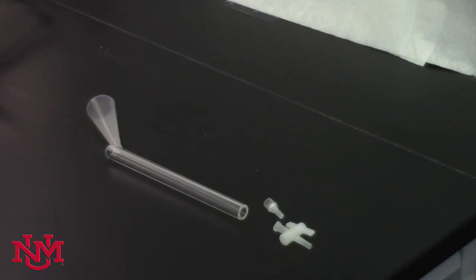You have already learned the techniques required to extract the pigment mixture from spinach: extraction with a separatory funnel, gravity filtration, and vacuum evaporation of organic solvents. Once you have your spinach extract, you will set up the column chromatography apparatus as follows.